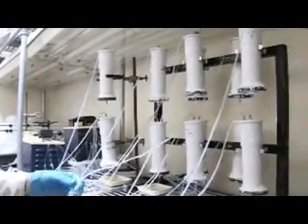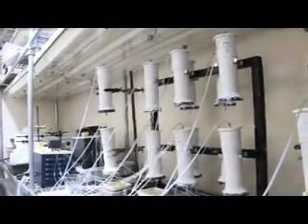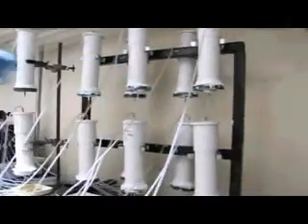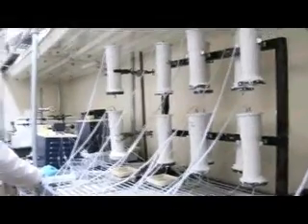What this scenario you see before you is really where I'm trying to create a lab example of that. So, what you have here is the low flow columns. These are the ones where the flow rate is constantly at a low level. And what happens is I put a spike — a peak of concentration — through very suddenly, to mimic that storm event. But I don't vary the flow rate.